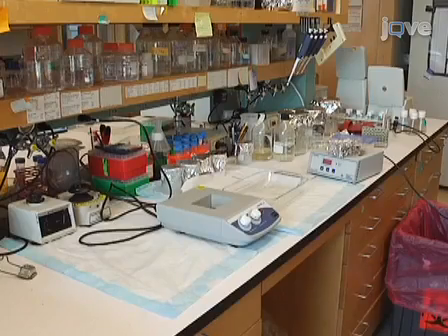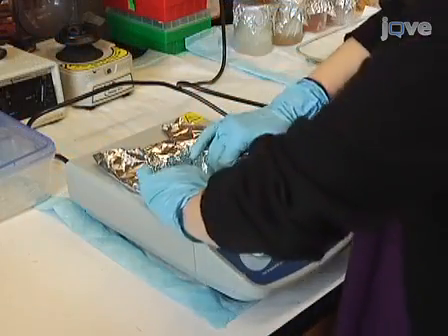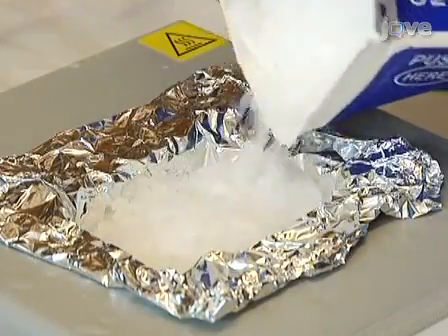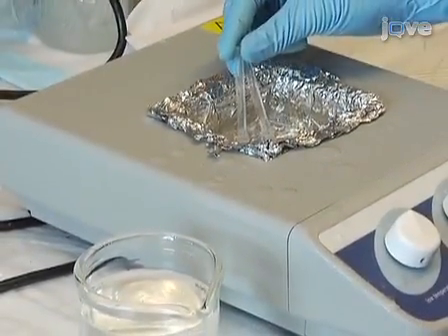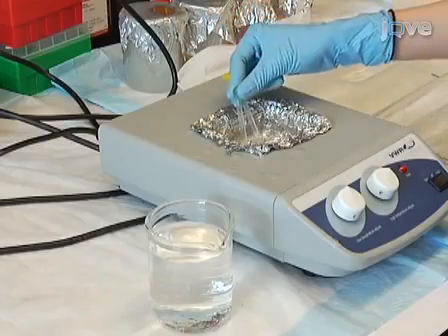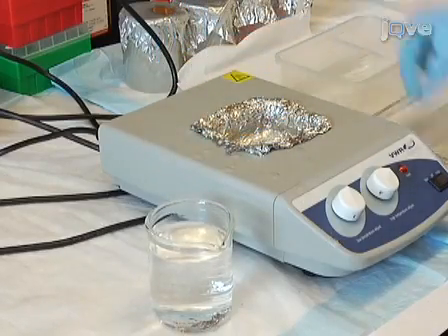Take a general laboratory block heater without the tube holder and cover the heating well carefully with several layers of strong aluminium foil. Add paraffin pellets to the aluminium-lined heating well to melt. Hold the tubes at the non-food end and dip the food end into the melted wax. Dip the waxed portion into a glass beaker filled with cold water to speed up wax solidification. Repeat once. Dipping the wax tubes into water will prevent the tubes from sticking together.